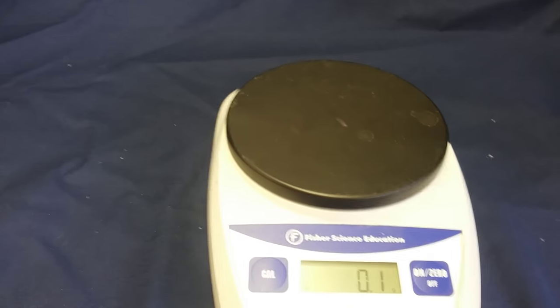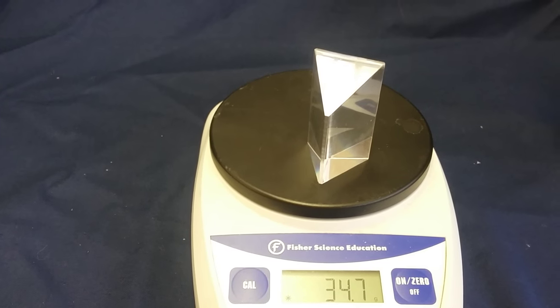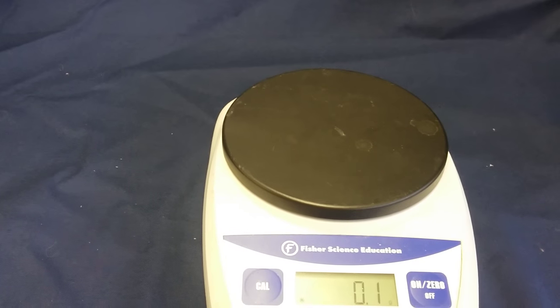If you're weighing something solid, like a spoon or a crystal, this is a pretty simple process. But what if you want to measure something that's a little bit harder to measure?